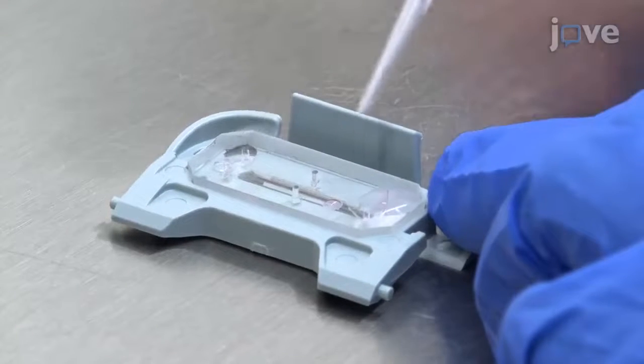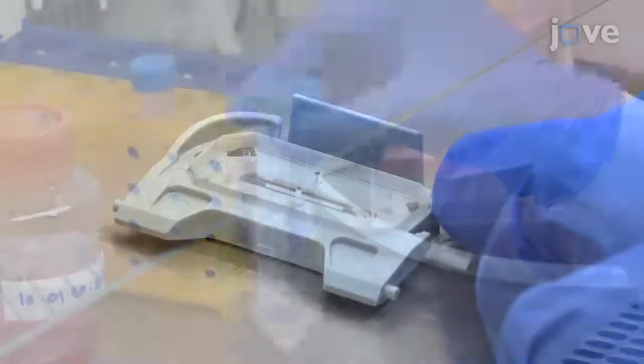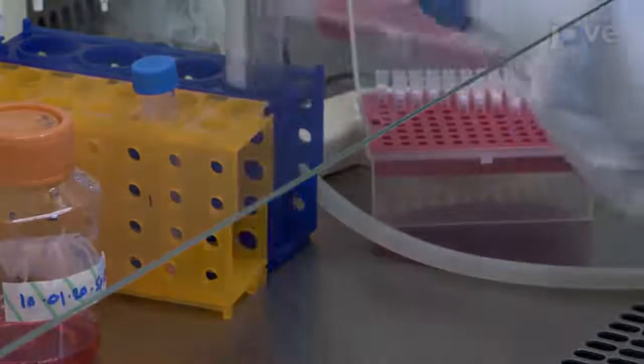Avoiding contact with the ports, carefully aspirate excess media droplets from the surface of the chip. Gently agitate the cell suspension to ensure a homogenous cell suspension.